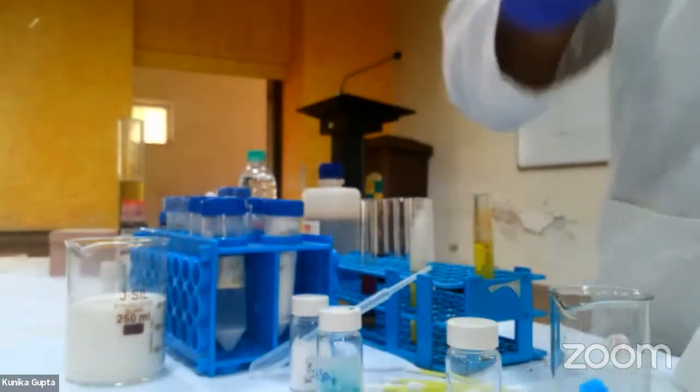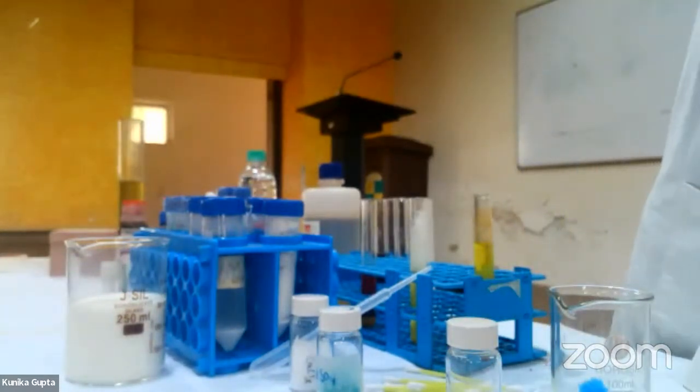Should we clean this out? Yeah, yeah. I have turned off the heat. But should we? You need the plate, right? Yeah, I'll need it later.